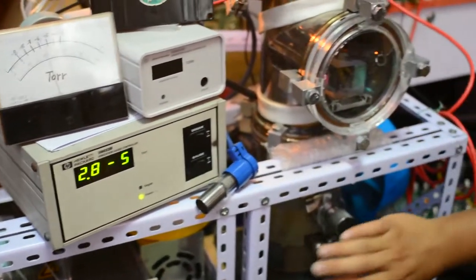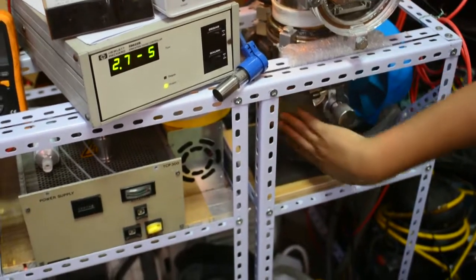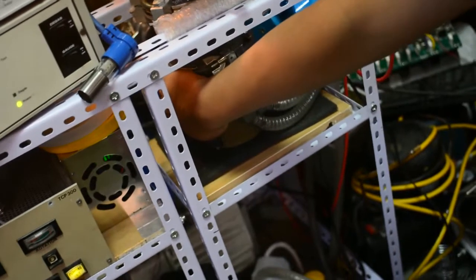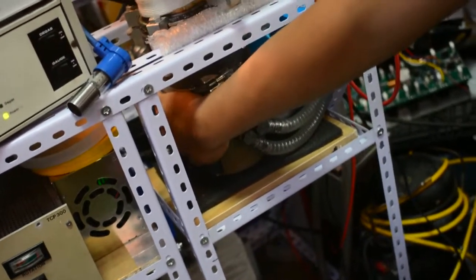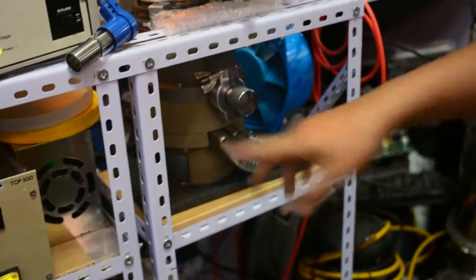Thanks for the turbomolecular pump. Now this turbomolecular pump is quite warm. I can still put my hands on this pump, but it is very hot.